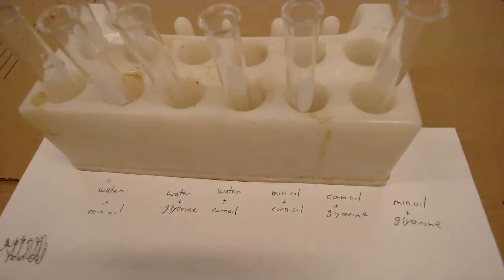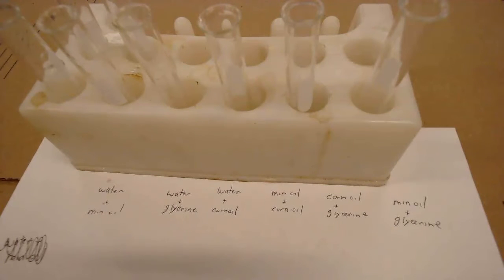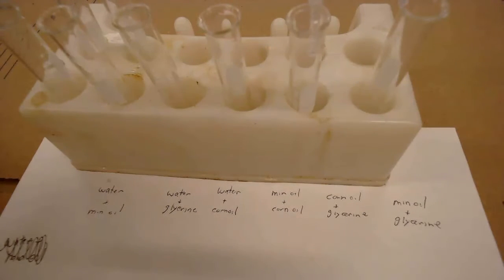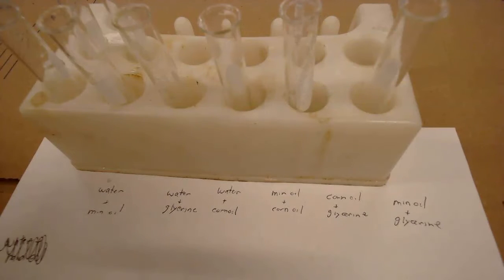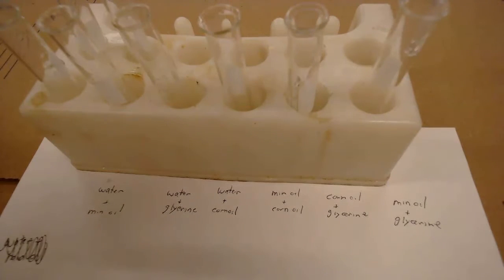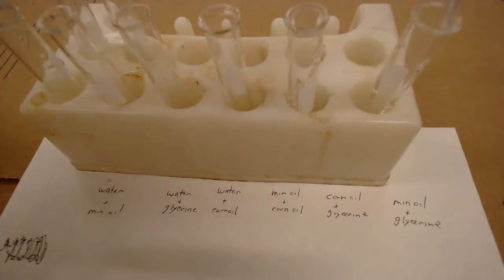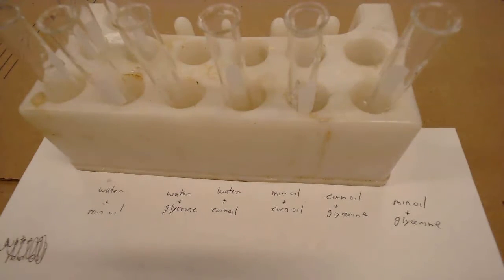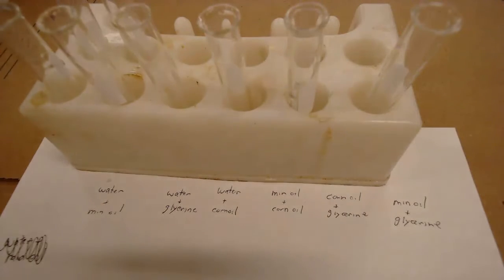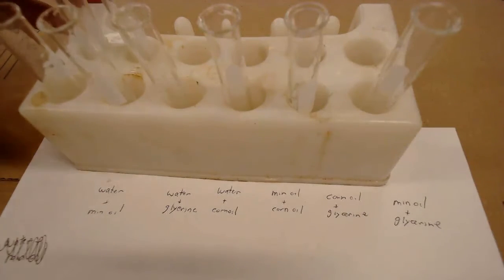That should give me all six tubes I need. Now you're going to be filling out the chart, and the chart has about eight different spots on it. Sometimes the results are going to repeat — like you'll have a spot for water and mineral oil, and a spot for mineral oil and water. So let's take a look at what we've got with these things.